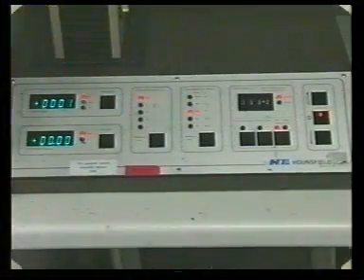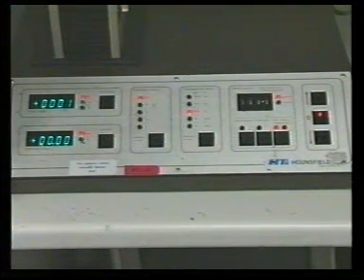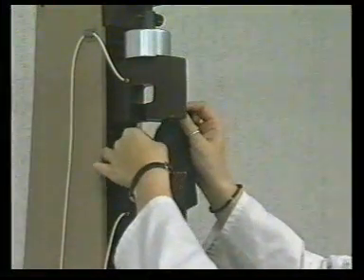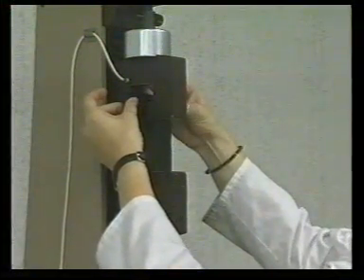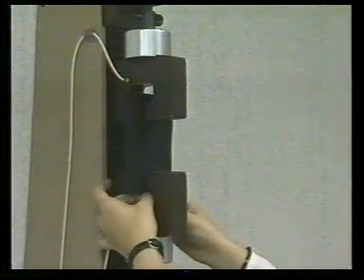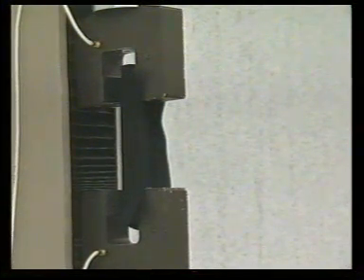The computer will set the machine up into the testing mode. An unseamed test specimen is mounted into the top jaw and clamped in position, and then mounted in the bottom jaw and clamped in position, ensuring that the specimen is straight. The start button is depressed and the machine allowed to apply the load until the specimen breaks.